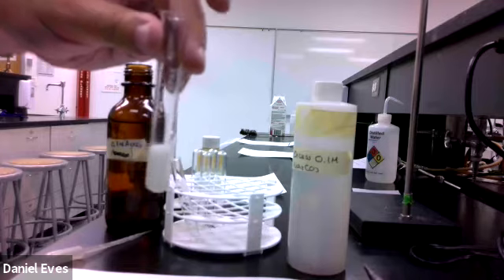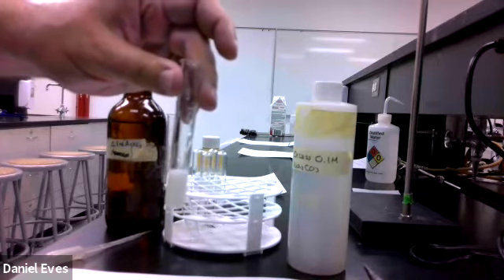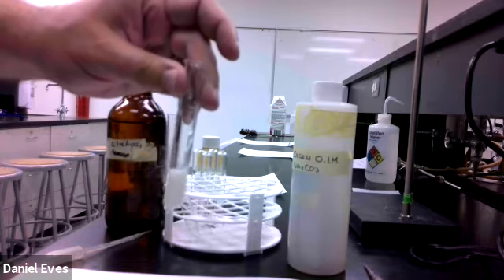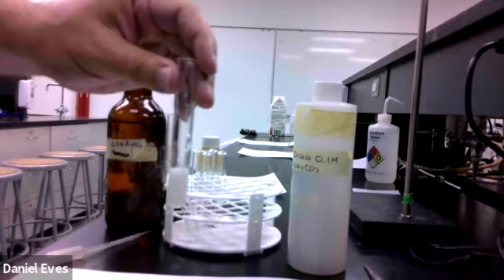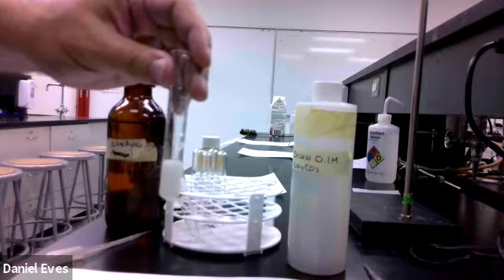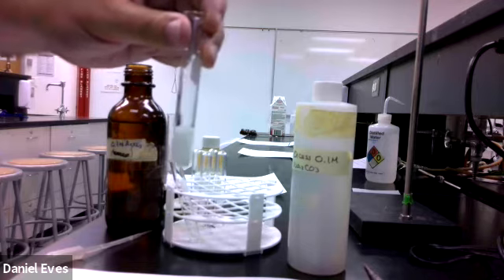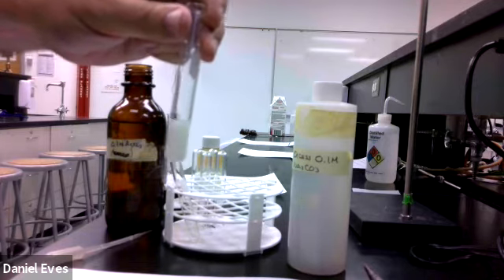Now, this brings up the age-old question, right? If you're not part of the solution, what are you? There's that age-old adage that if you're not part of the solution, then you're part of the problem. Well, in chemistry terms, if you're not part of the solution, you're part of the precipitate. So that's what we have here.